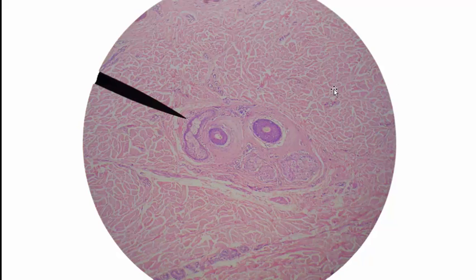This is another collection of similar stuff that we've already seen. This is at 100 times magnification, and we see a sebaceous gland. Sebaceous glands are always associated with hair follicles, by the way. This is a hair follicle, and now at this higher magnification, we can see inside of it, that little kind of yellowish structure is the hair shaft inside of the hair follicle. Another hair follicle with a larger hair shaft in the middle of it. And this over here is more sebaceous gland.